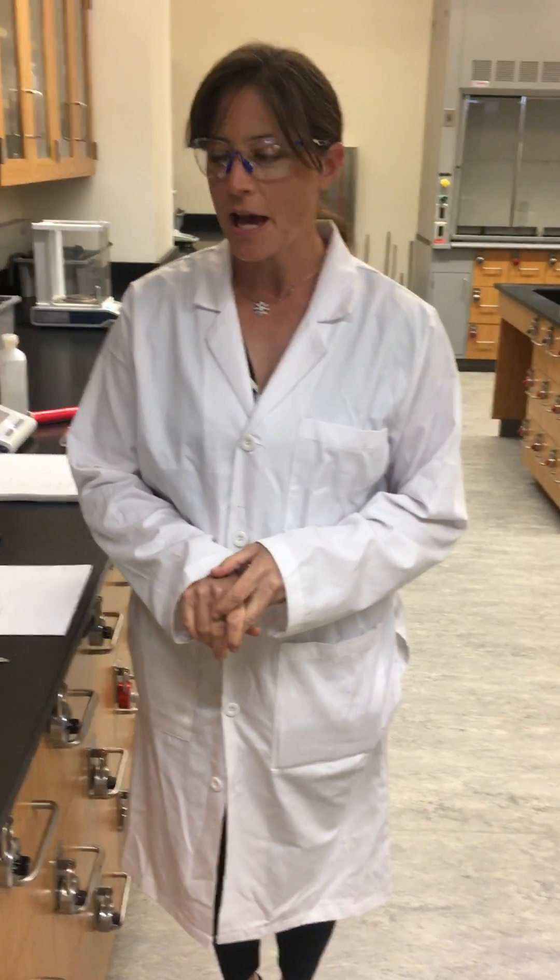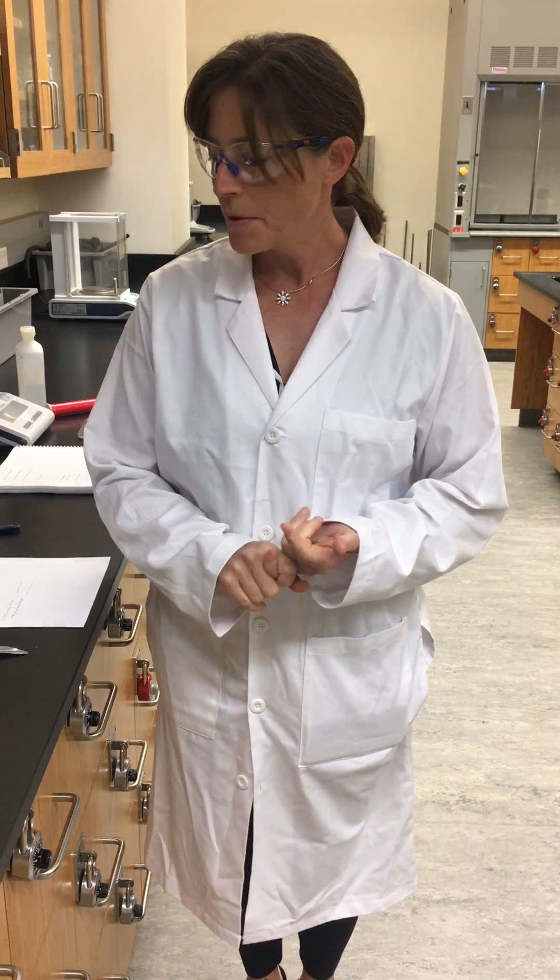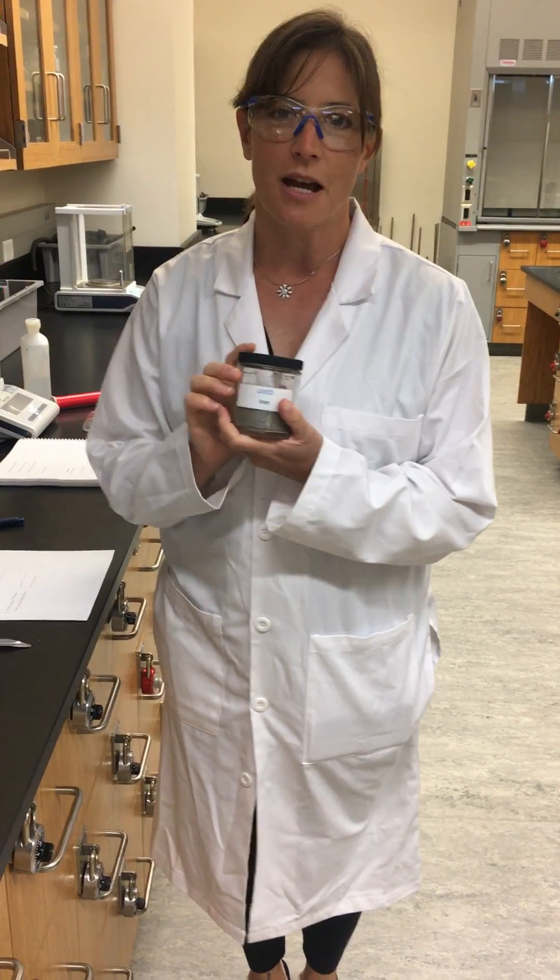Part B is going to be looking at three different substances. We'll be looking at a solid, a liquid, and a gas. So what we'll do first is we're going to do it for a solid. And so the solid we're using is iron.